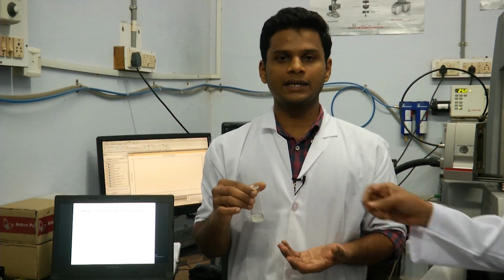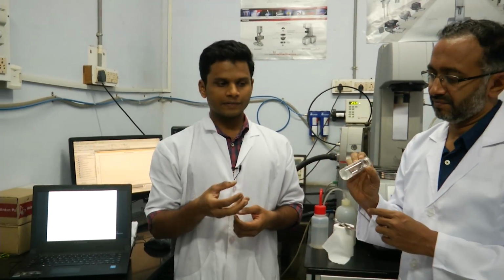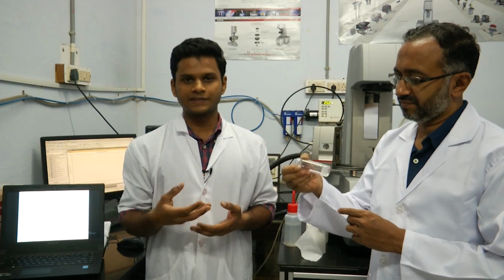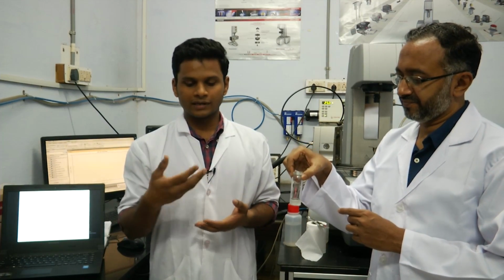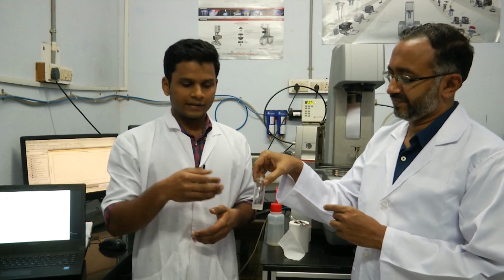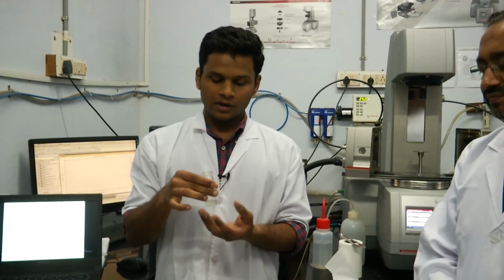This polymer is widely used in the food industry. It is an ingredient in jams and fruit juices due to its stabilizing property, thickening properties, etc. So this particular fluid during its processing stages often undergoes shear flow, and therefore this fluid, being a viscoelastic fluid, will experience normal stresses which are not negligible.